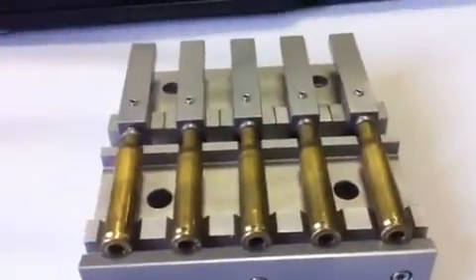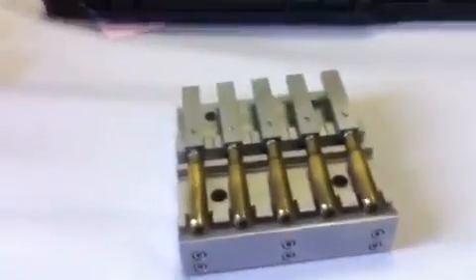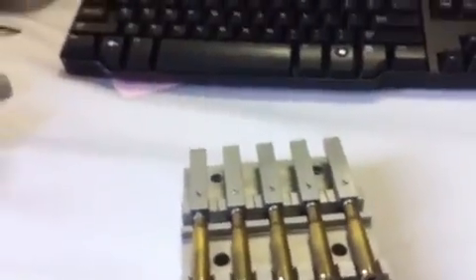It's very difficult to do with one hand, but the idea is that you can quickly and easily mount each bullet shell into this 5 bullet shell fixture, mount the fixture on the stage, and just go ahead using coordinates, quickly load 5 bullet shells, define one starting location, and you're off and running. The software will take care of the rest, and you'll have all your data.